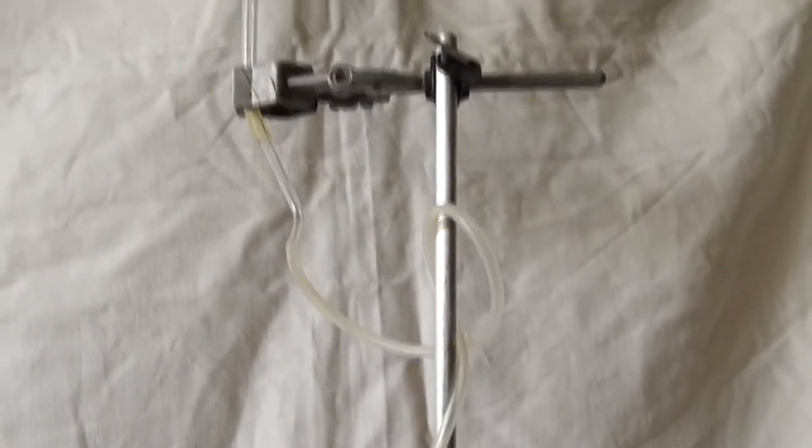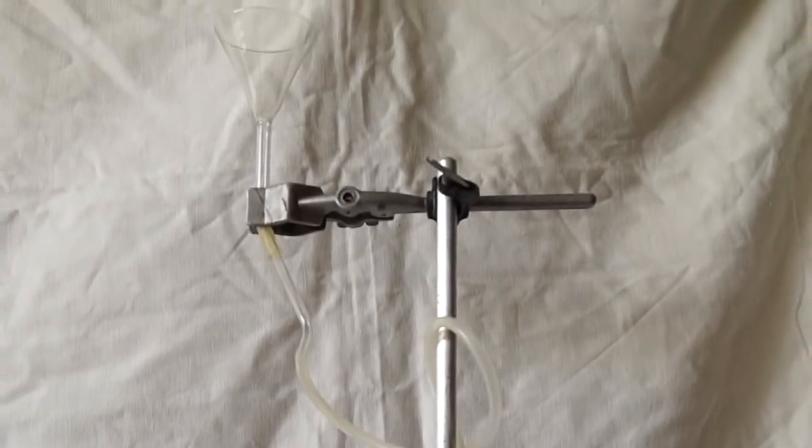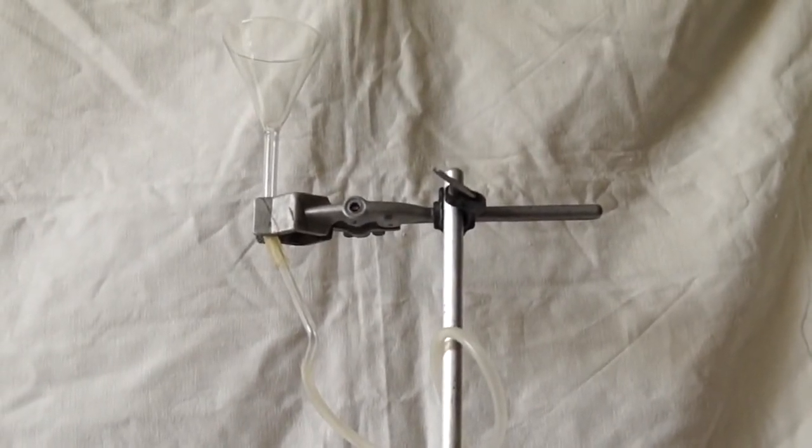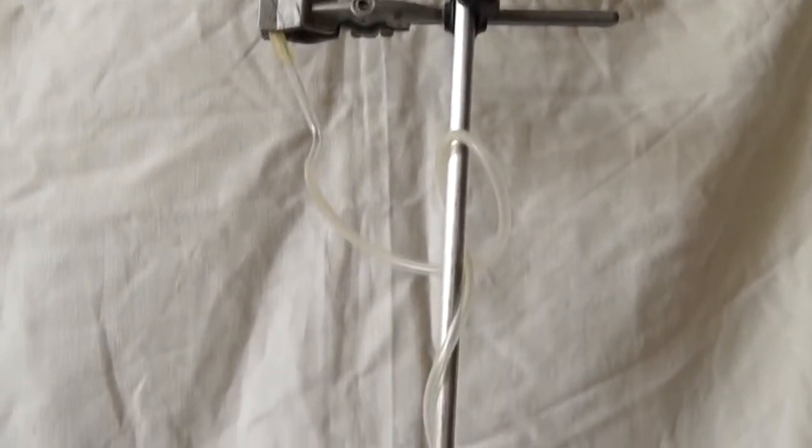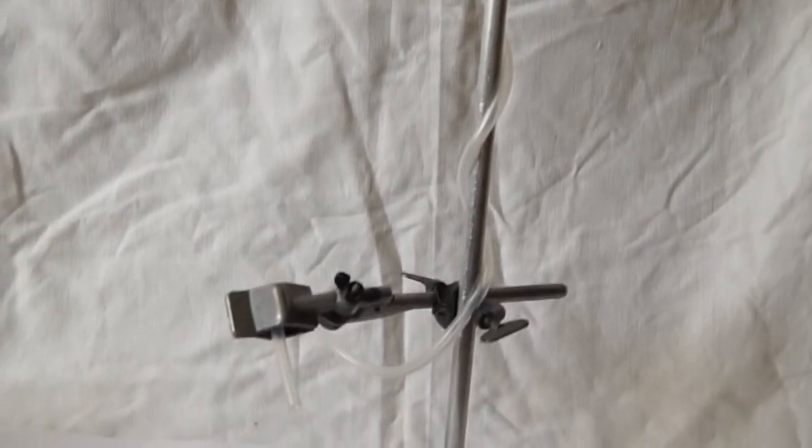Also, for a more effective reaction, I have prepared such an interesting system. I'll pour both solutions on top of the funnel and they will mix in a tube, and we will see a very nice glowing effect in motion.